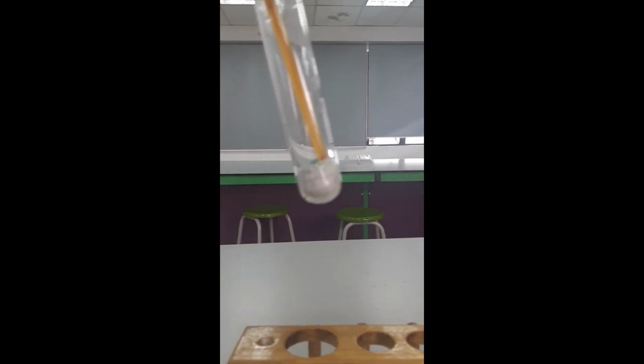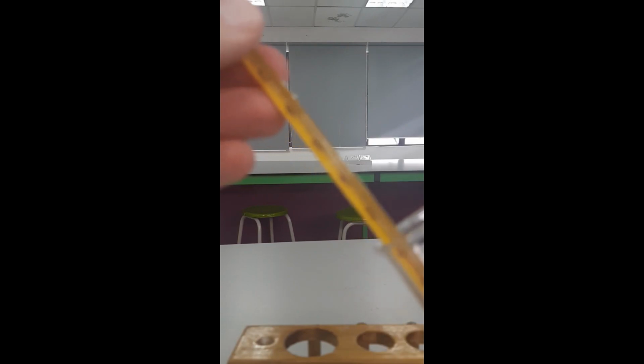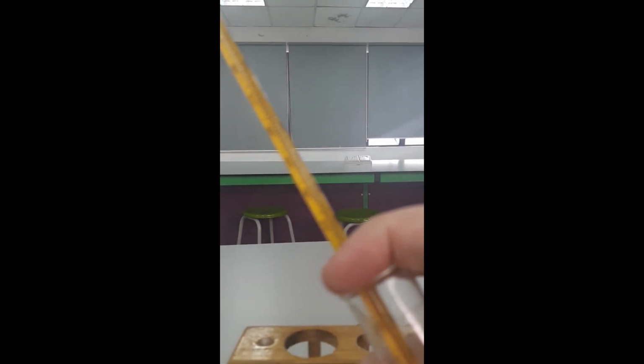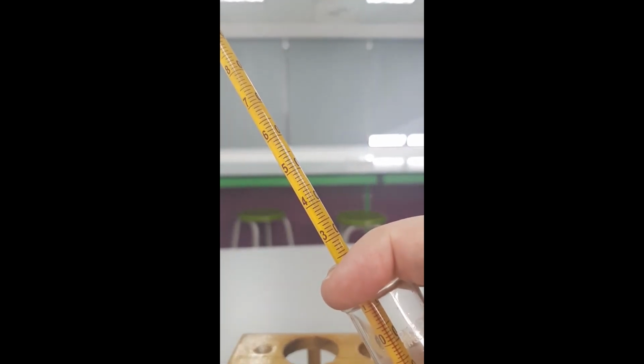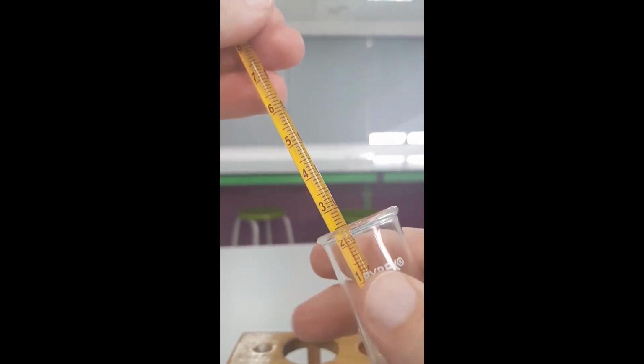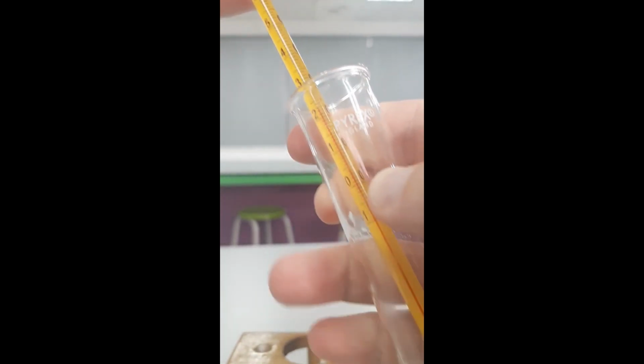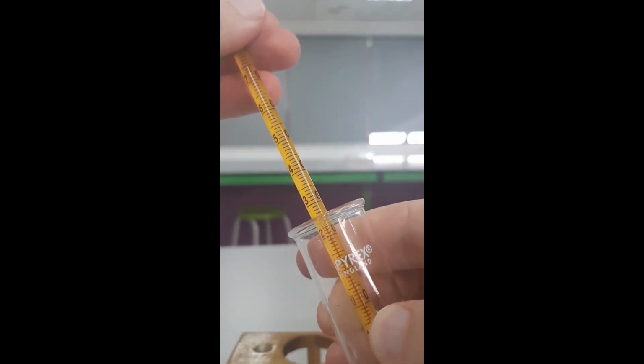This is now later. What I'm doing here is I've allowed it to cool, and I have a thermometer which I'm going to put into the cooled down to room temperature copper 2 sulfate. It's the same stuff from before. This is the anhydrous copper 2 sulfate. It is cooled down to room temperature. If I can get it to focus there, we'll see that room temperature is about 23 degrees Celsius there. So this is anhydrous copper 2 sulfate at a temperature of about 23 degrees Celsius.